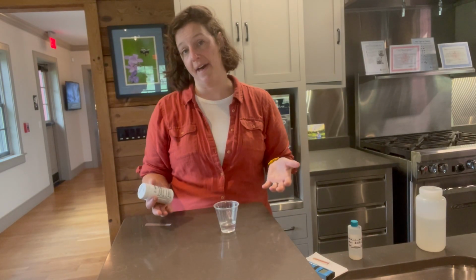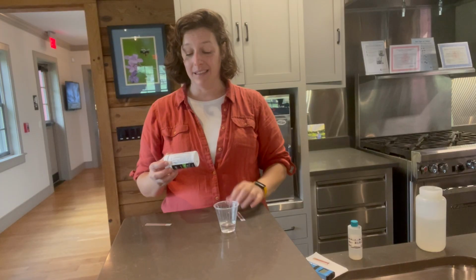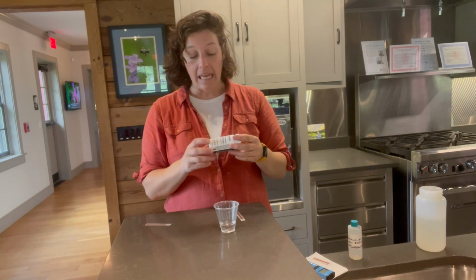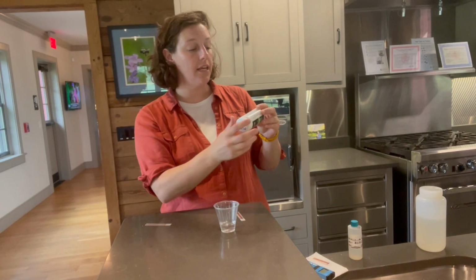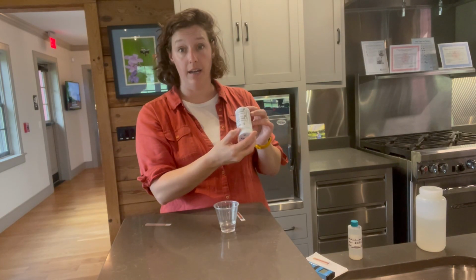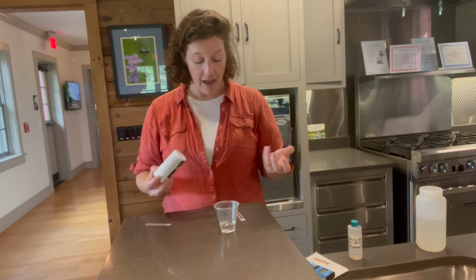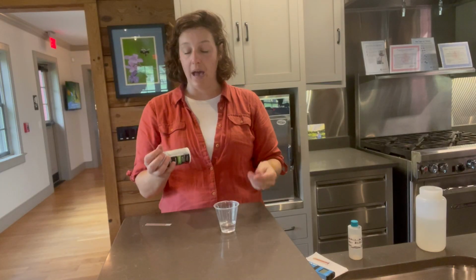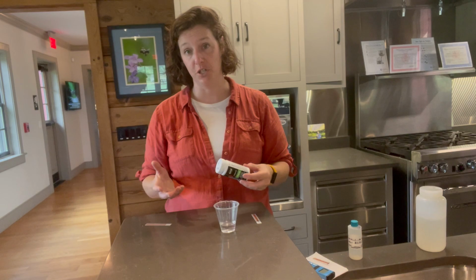So one question you may have is, what do I do if the reading I'm getting from my test strip is less than or more than the conversion table numbers? So if you have a bottle in front of you, you can take a close look and you'll see that for this unit, or this lot number, the lowest Quantab unit number starts at 1.4. However, on the strip itself, it begins at 0. So if you have a very healthy stream with low levels of salt, it's possible to get a reading that does not actually show up on your conversion table.